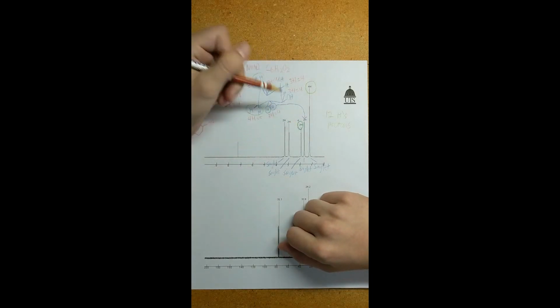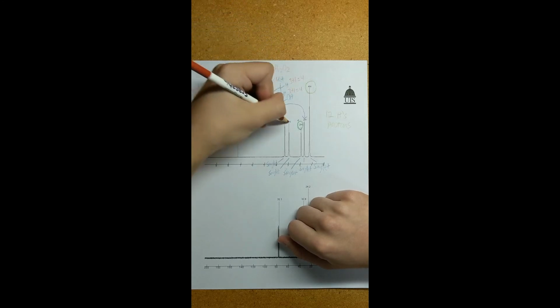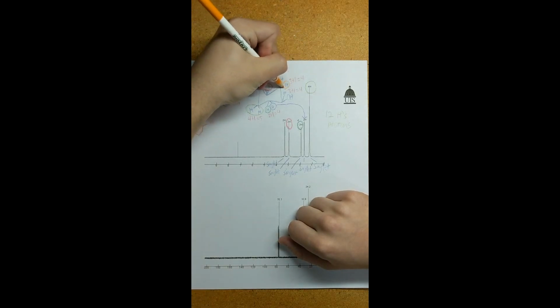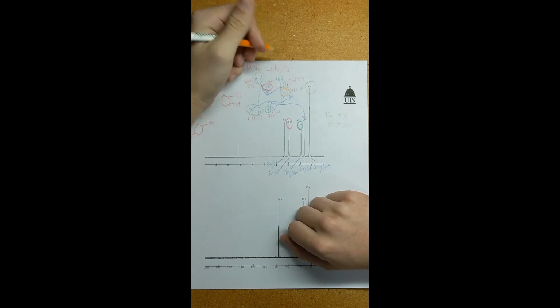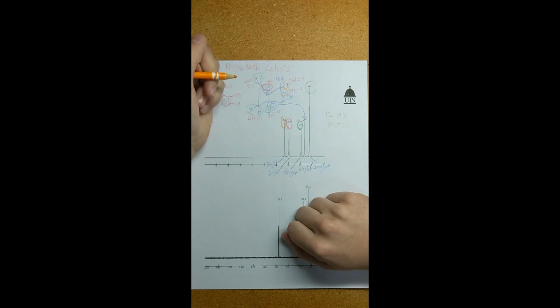So now moving on to our fourth peak, definitely going to be this group here. Two hydrogens, that makes plenty of sense, and they're much less deshielded than these hydrogens that are attached to the alcohol groups. So those two are going to be referenced here. And finally, moving on to our last peak, this makes it quite simple, because these two hydrogens that are directly attached to the alcohol groups are going to be the most deshielded, most downfield, because of their proximity to those. So that makes perfect sense that both of them together would be on this peak.